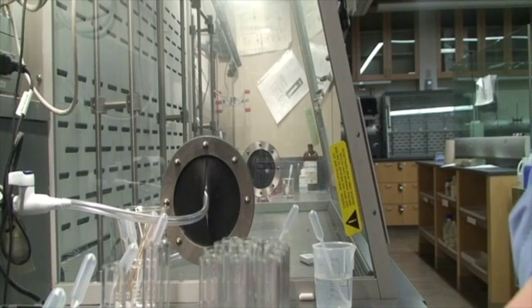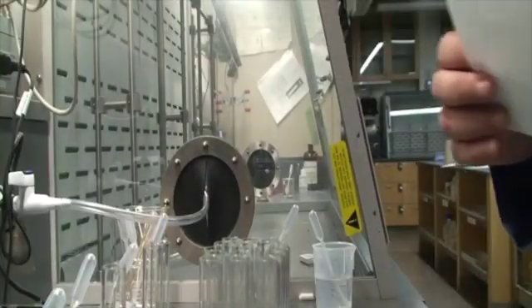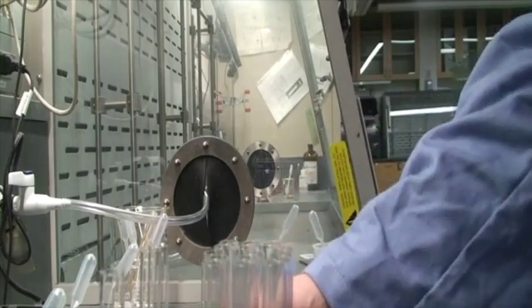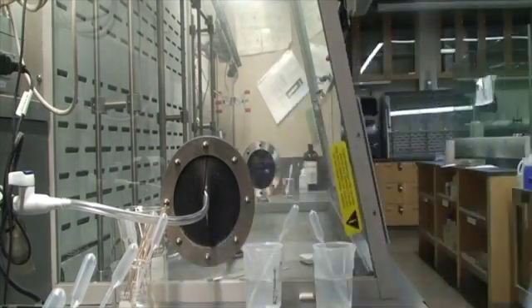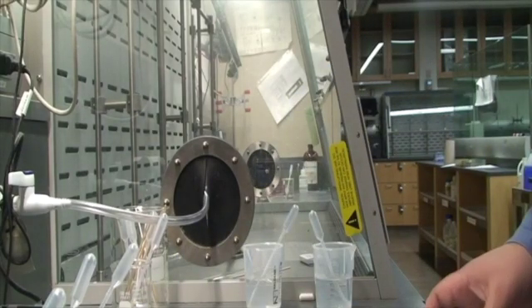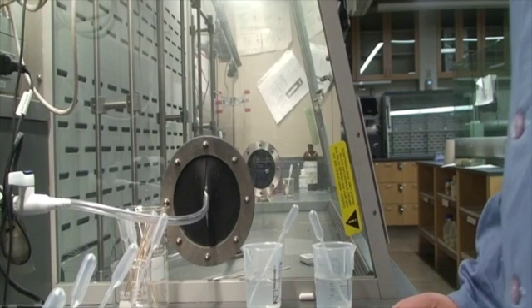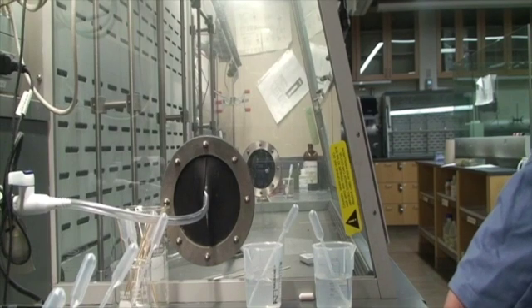So we're going to take a look at an unknown. I have unknown G. I'm not going to give you any planning, but I did do some planning. You can think about why I decided to plan this the way that I did. Okay, so unknown G, I believe, has 3 ions in it. And I have 3 things that I'm going to try.